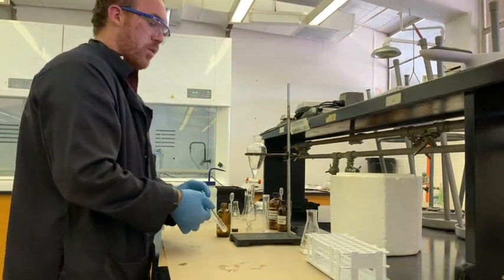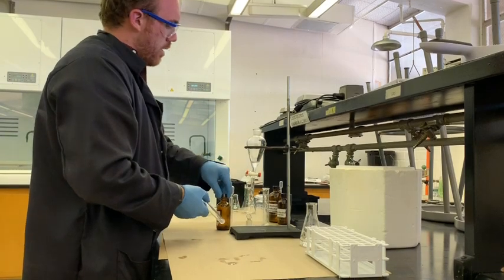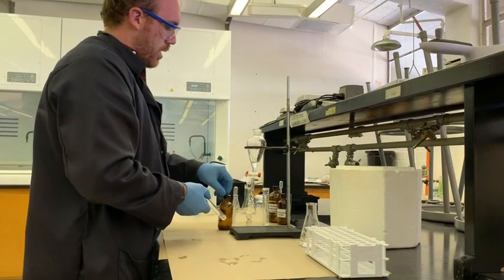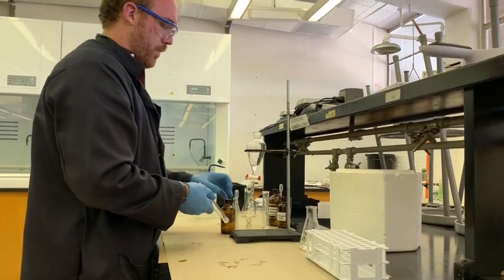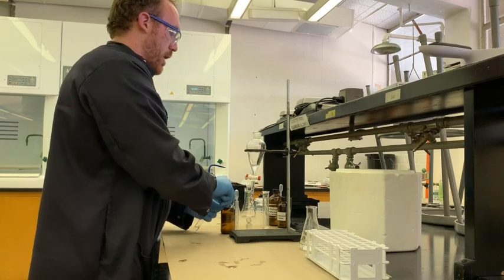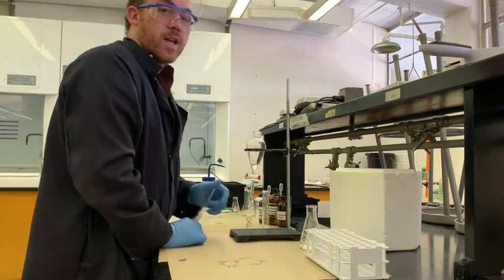Well, awesome. So that's all we're going to do today for the experiment number 7, for SN1 reactions, and enjoy the post lab.